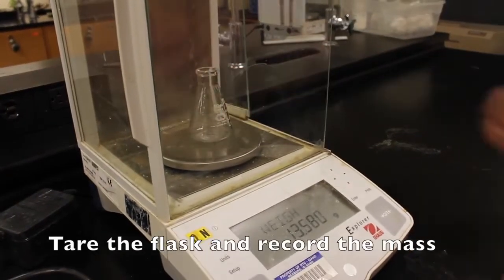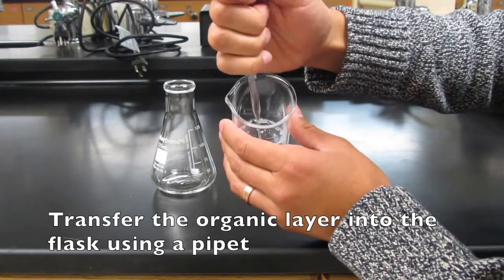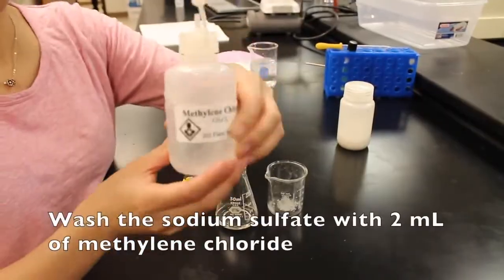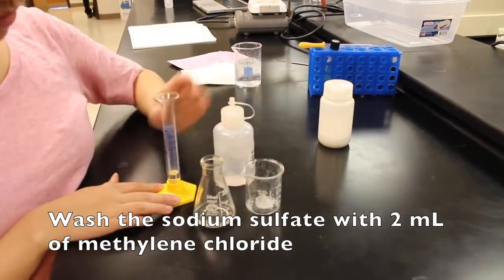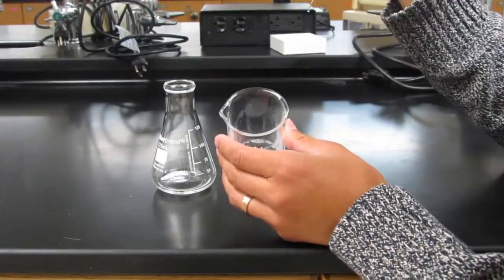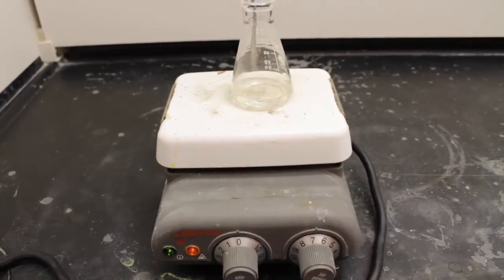Tare the flask and record the mass for later calculation. Using a pipette, transfer the dried organic solution into the tared flask. To get all the product inside the beaker, wash the sodium sulfate with 2 milliliters of methylene chloride and add it to the flask. Boil off methylene chloride in the hood by heating the flask.